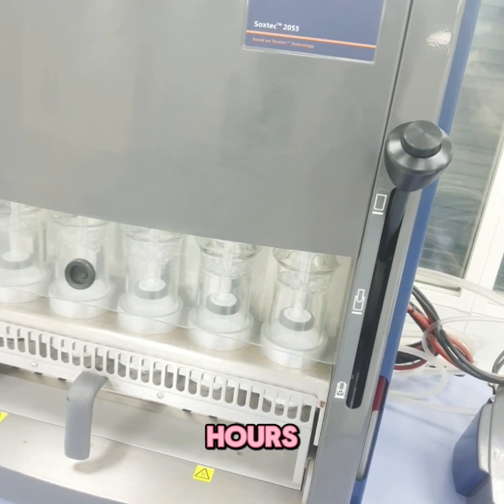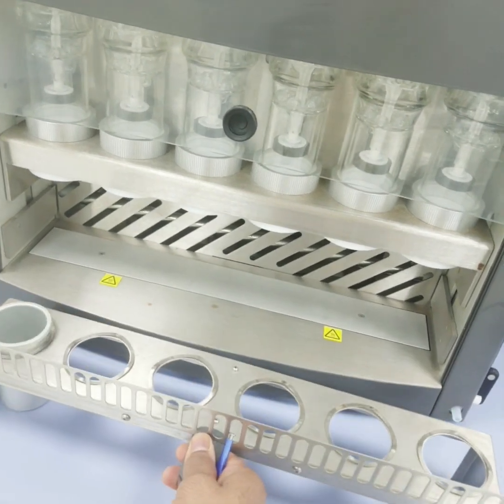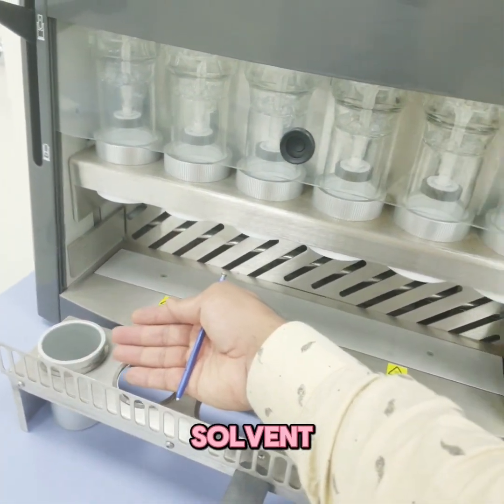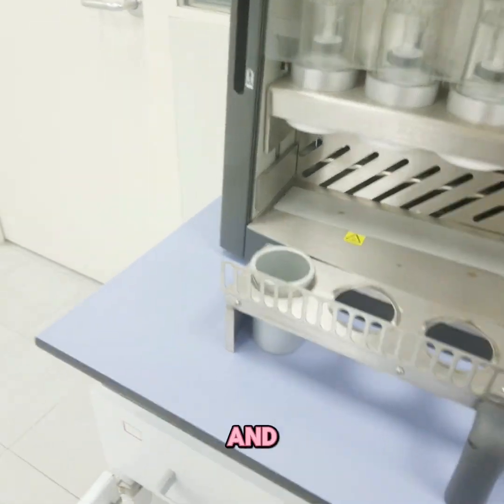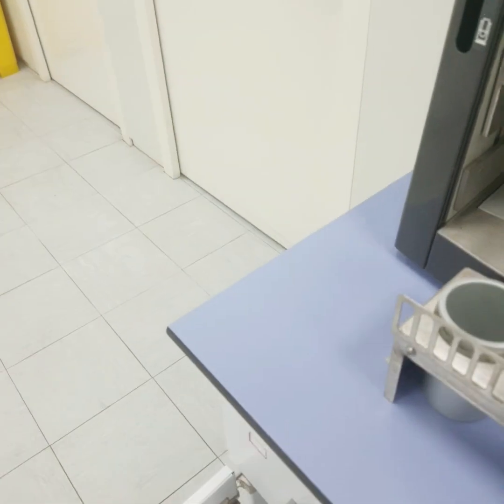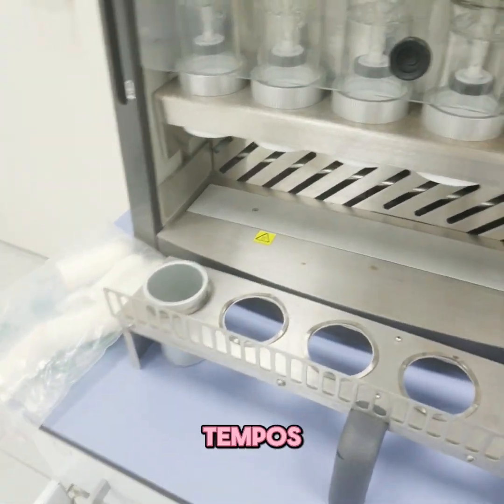The system can process six samples at a time. You can see the sample holder here where the fat is extracted. The solvent — for example hexane or dichloromethane — is placed here. We also have thimbles, which hold the samples packed with cotton or some kind of tissue, along with extraction cups.